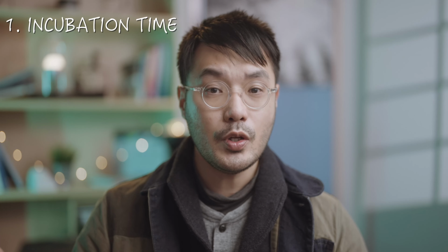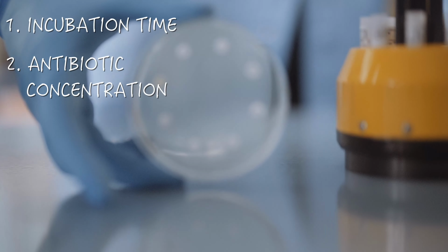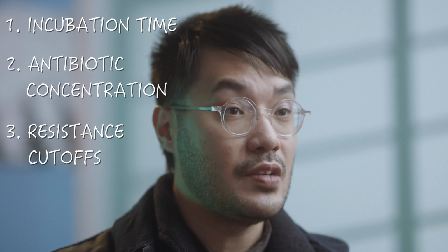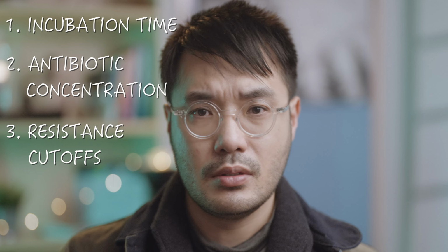Let's pause here for a second and look at three design parameters. 1. How do we know how long to incubate the plates for? 2. Each of the antibiotics added is at a given concentration. How do scientists figure out that this was the best concentration to use? 3. The standardized value that determines if a zone is resistant or sensitive to an antibiotic. How is this determined? The truth is, all of these parameters weren't landed on by luck. They were systematically tested again and again until the most optimal version of the experiment was figured out.